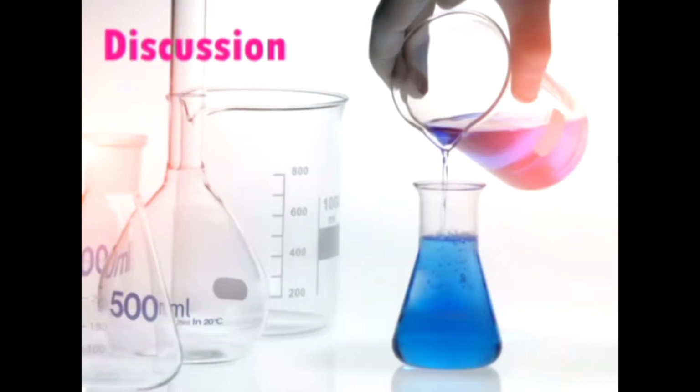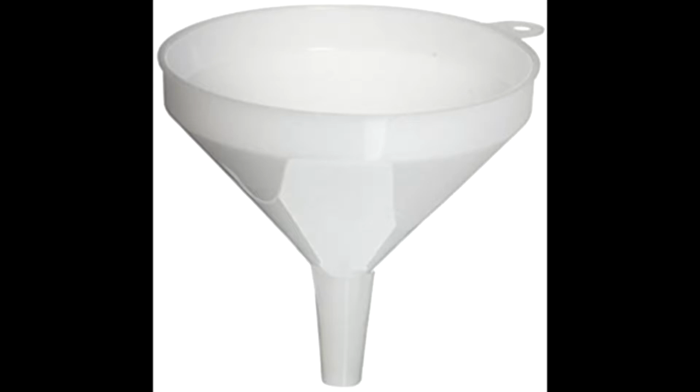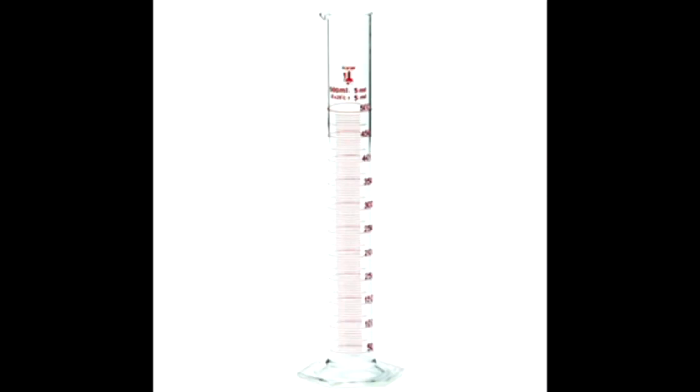The purpose of this lab is to find out how changing the amount of reactant used changes the amount of product that will be created. In this lab, we used a beaker, a burette, test tubes, a funnel, KOH, CuSO4, and a graduated cylinder.